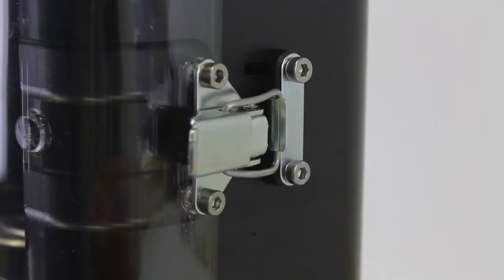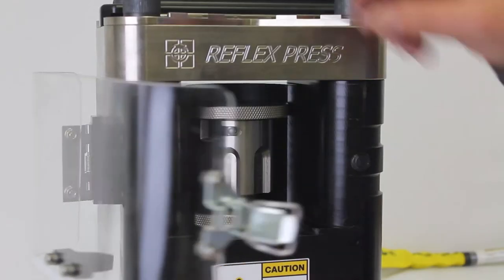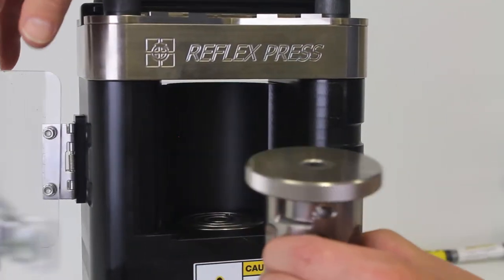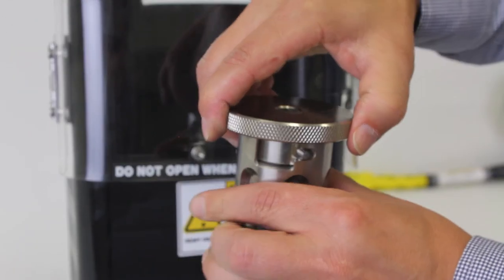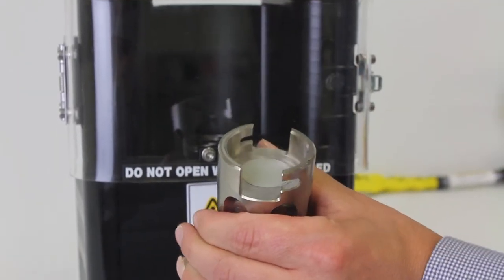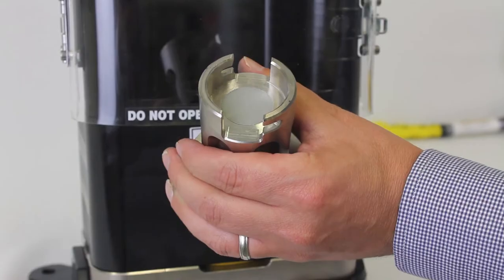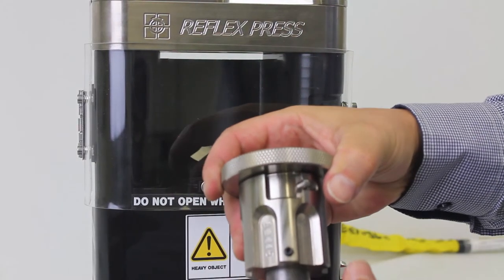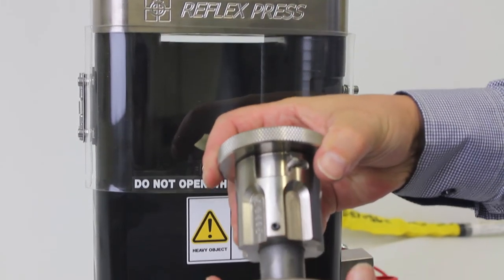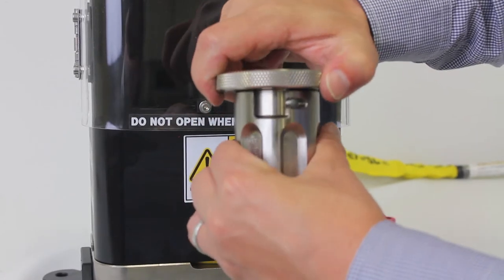Allow the pressure to release fully. Once released and the cylinder is fully retracted, open the door and remove the die. Remove the cap off the die. If you're using the standard die, the sample is ready to be pressed out. If using the premium die, grasp the die body and pull the shaft while twisting to extend the die, then reinsert. This loosens the ring from the shaft and makes removal easier.